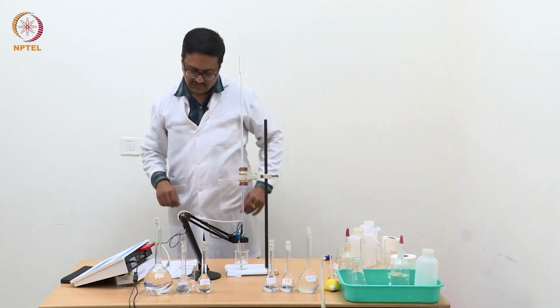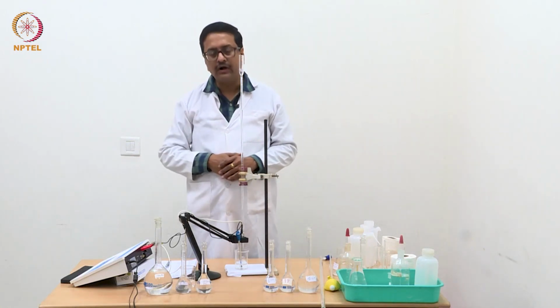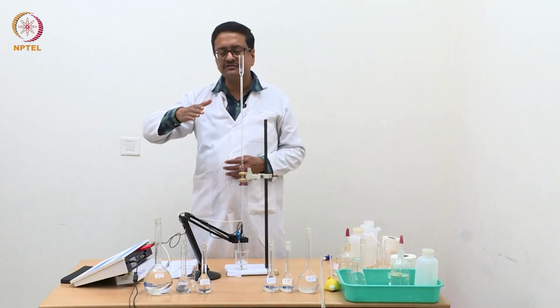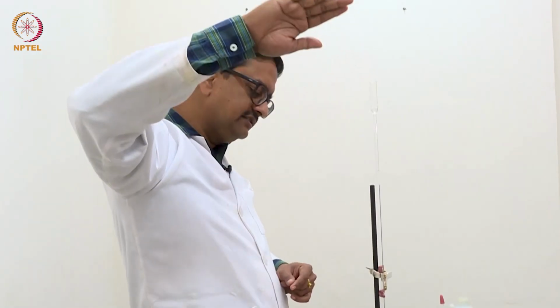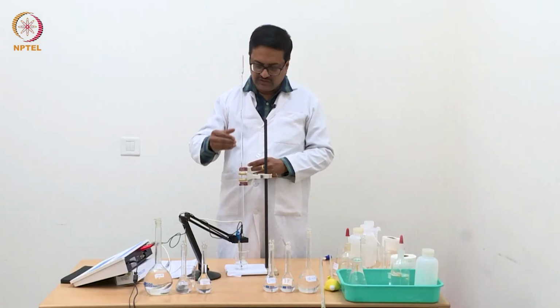So we have seen a change that was happening between 0.28 and 0.4 ml. So the constant decrease got reduced and the conductance values were flat for a while, and then it started increasing slowly and we continued up to 1.4 ml, which is much beyond the end point of this triple mixture titration. So with this we are finishing the first part of this triple mixture estimation with NaOH.